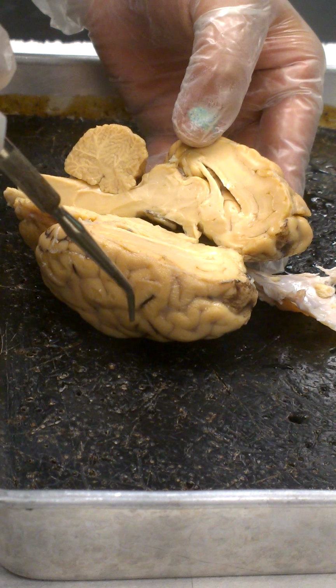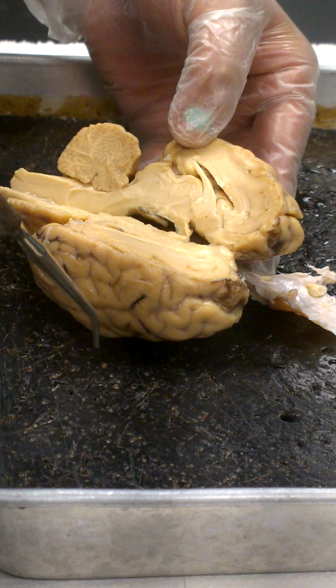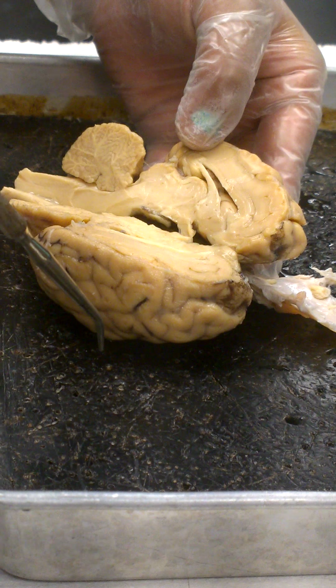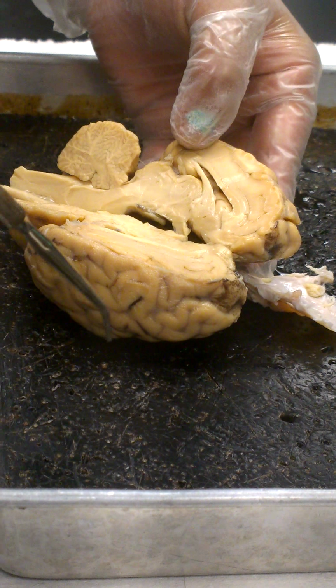Extending off from the back end of the corpus callosum and coming forward, a little tongue sort of, I'm going to open up the ventricle. She never switched. She had a better half on the other side. She lied to you when she said this was better.